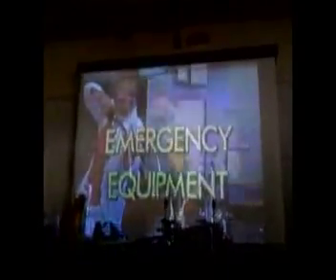Fires are always a potential hazard in chemistry labs, especially when organic liquids are involved. Small fires in containers can often be put out by covering them. Turn off the burner so the fire won't reignite. Larger fires require a fire extinguisher. It should be operated by a teacher, not by a student.